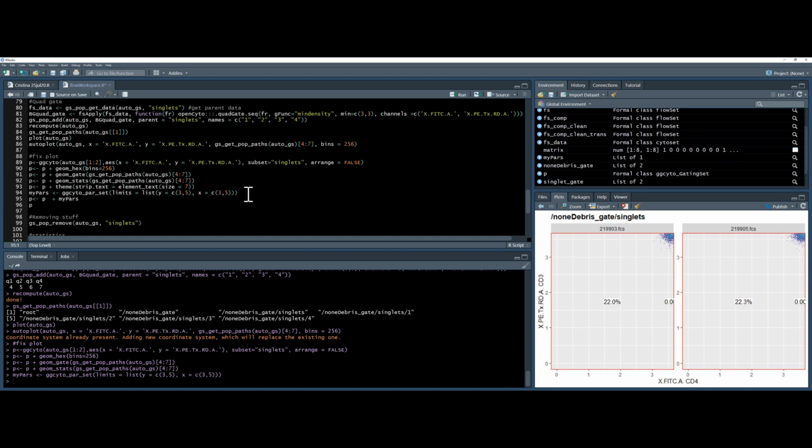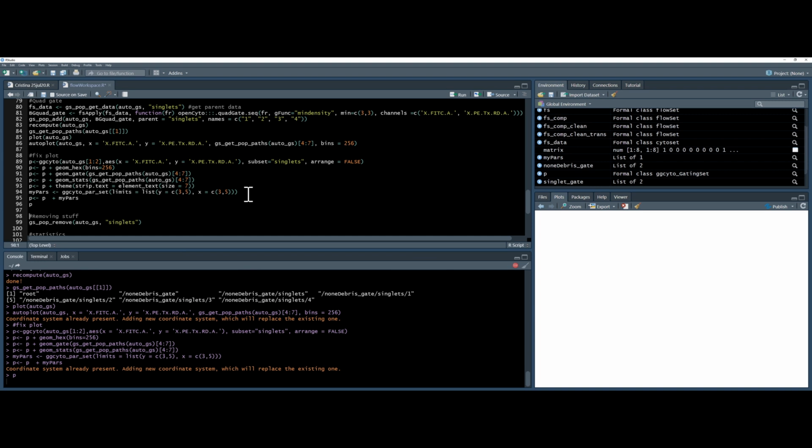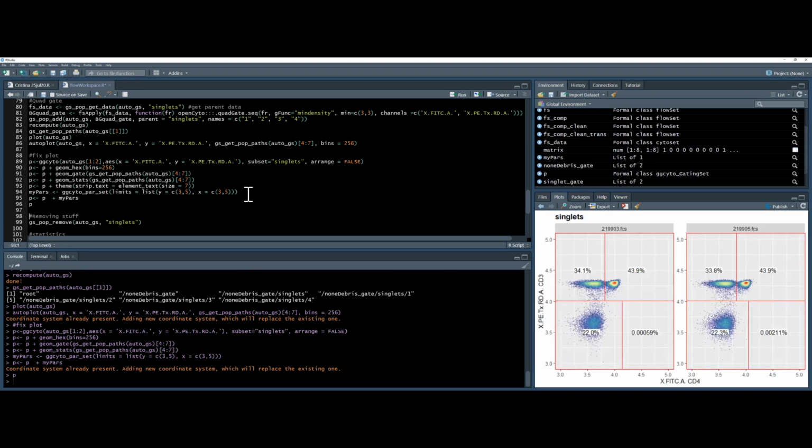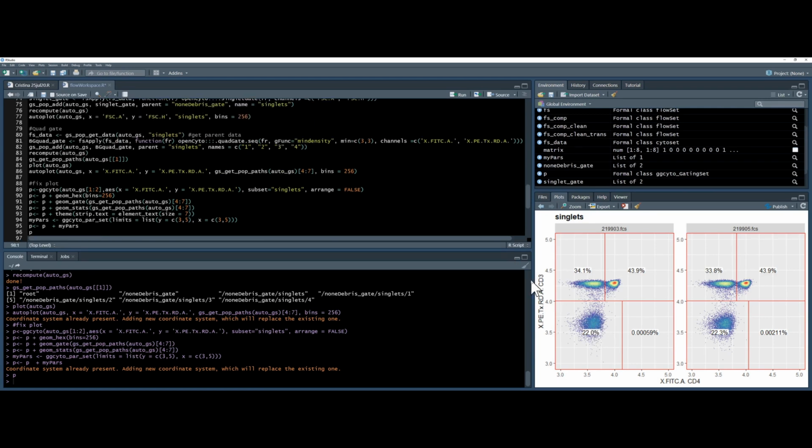I'm going to apply myPars to my picture, and then I'm going to load the picture by typing P. And there we go. We have some nice gating. It's worked quite nicely. There's a few other commands you could use for Quadrant. You could specifically say, I think my first cluster is here, which is quite useful if your clusters aren't well defined. You could obviously do this to a single control and then apply it to all of them.